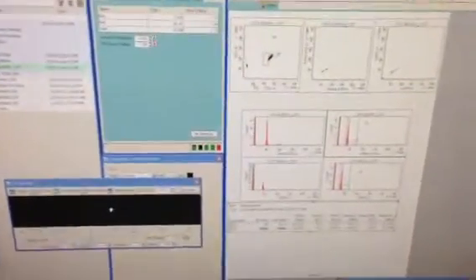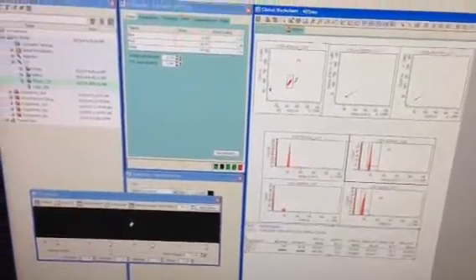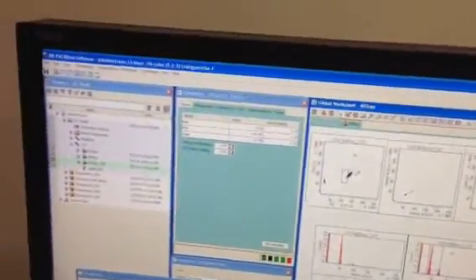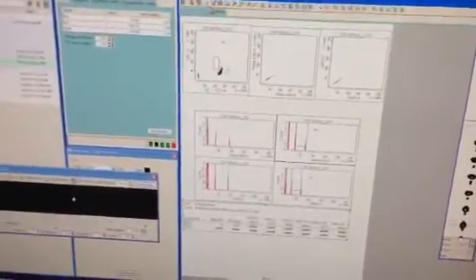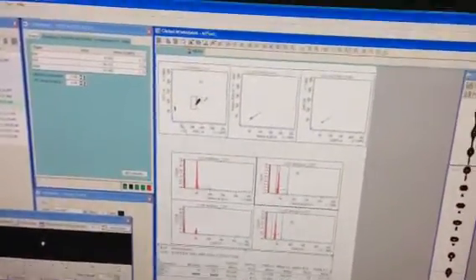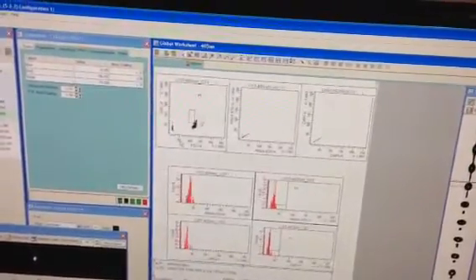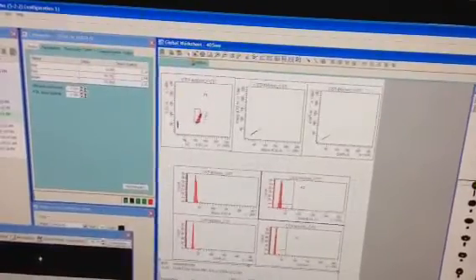Just as an example, this is where we started, where there was a little bit of a skew on the population. The DAPI channel was a little wide. And what I can show you is when I just adjusted the sweep. When I adjusted this sweep here, we're trying to optimize, this is one that's visible from the front of the machine, we're trying to optimize the peak of the detection. If you go too far, it goes back down again. So we just adjust it so that it's at the highest point.